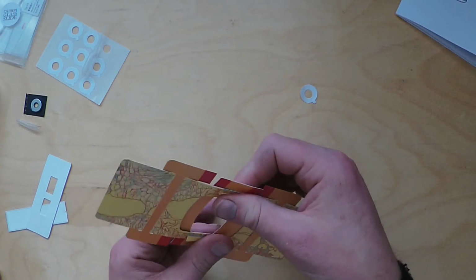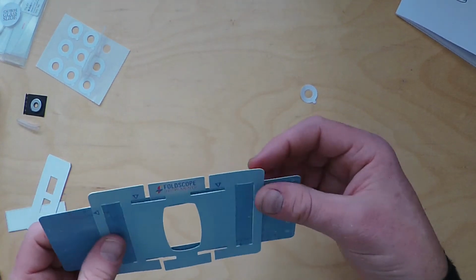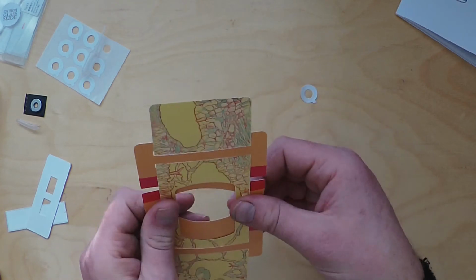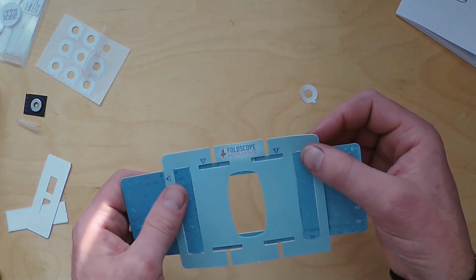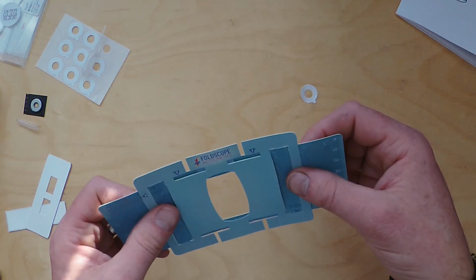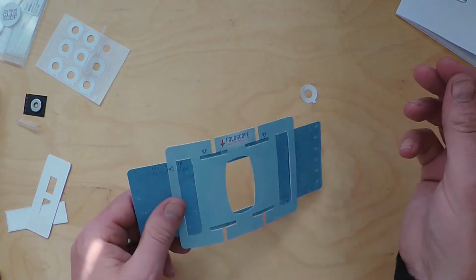It'll make sense shortly. We're now going to connect the two things together. So if you've done it correctly, when you flip this over, you'll see the X arrows point to some numbers there. Let's leave it at 0 for now. And the Y's aren't showing anything yet, but you'll see. Once it's assembled, it'll make sense.